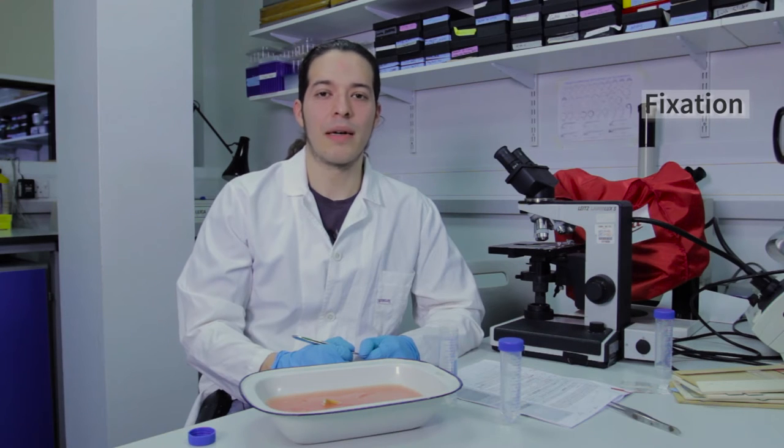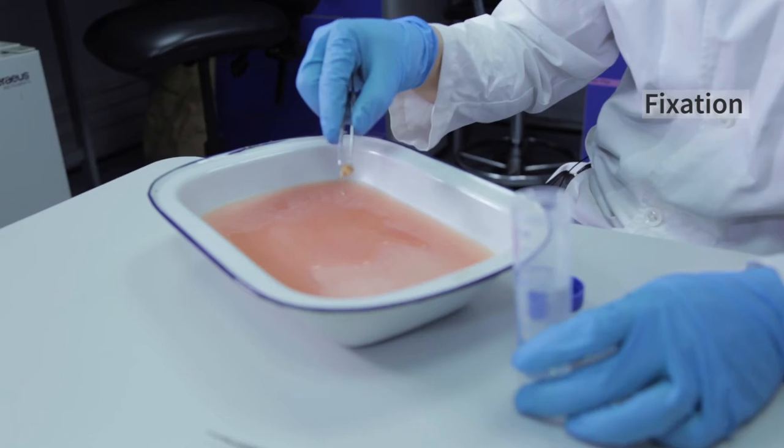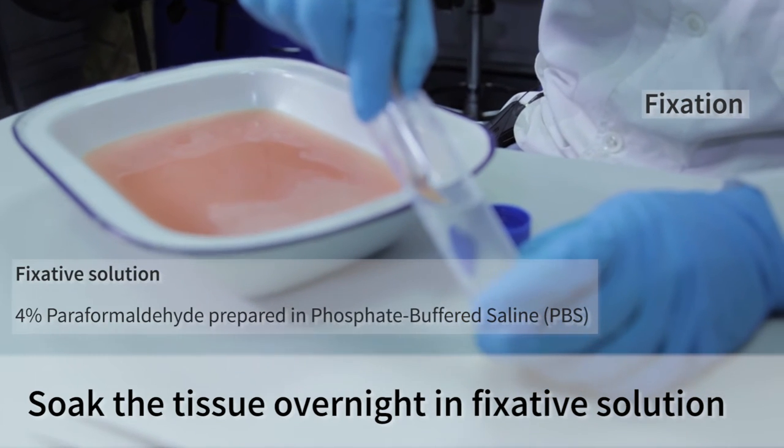The fixation step keeps the tissue from decomposing or being damaged by bacteria or enzymatic activity. For this, I will fix the starfish arm by soaking it in 4% paraformaldehyde overnight.